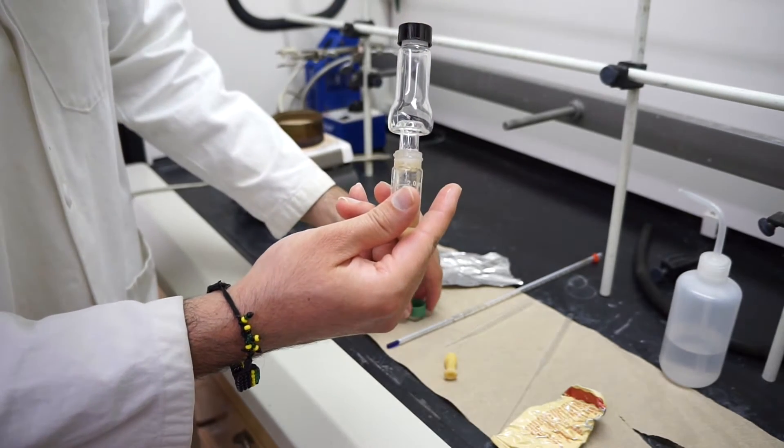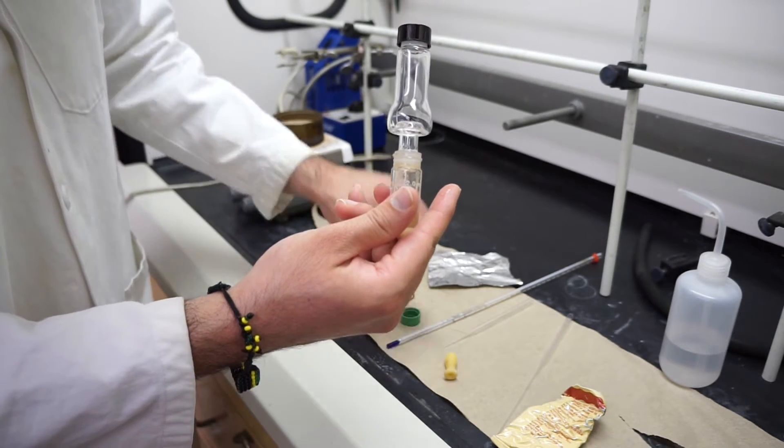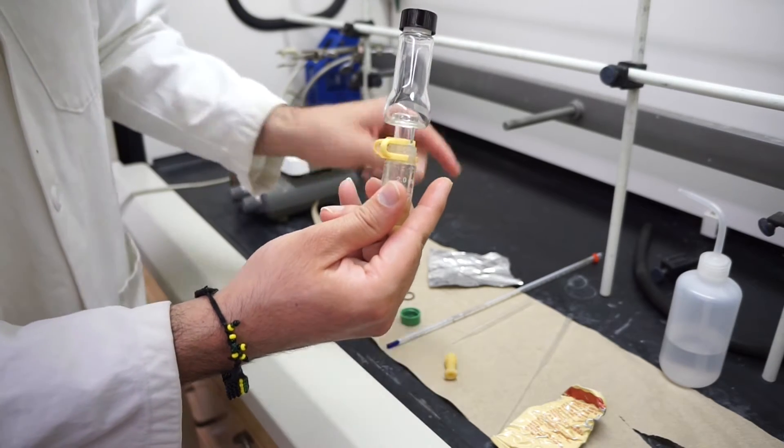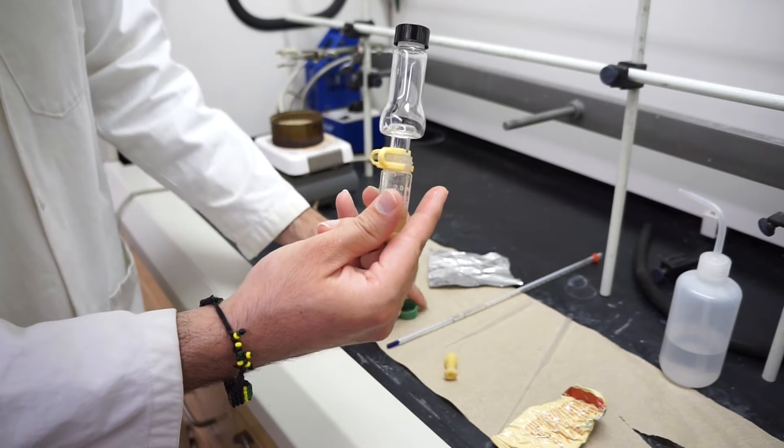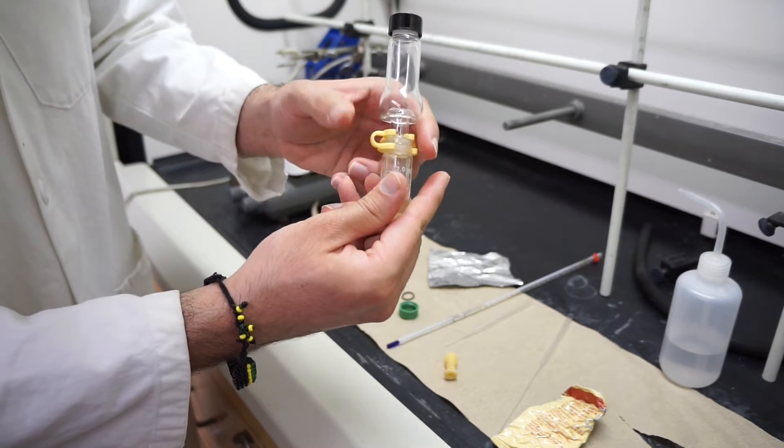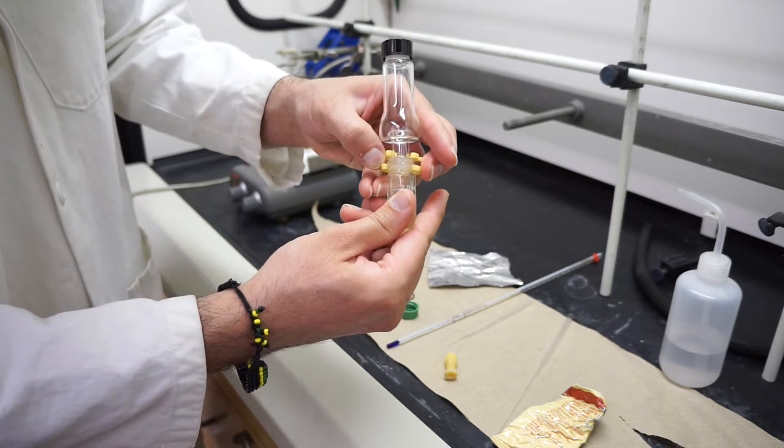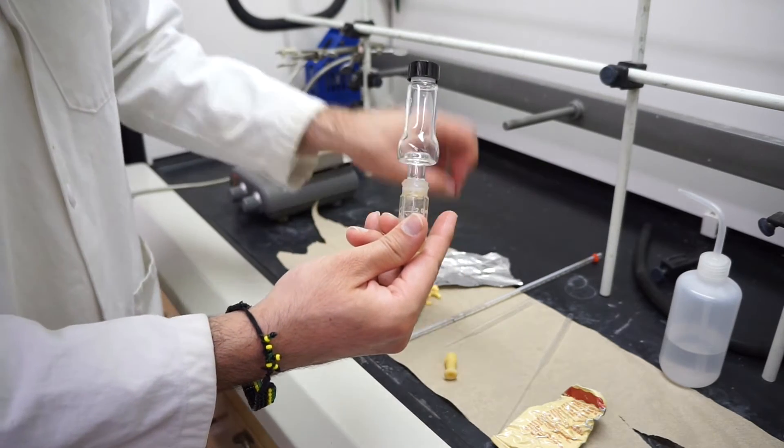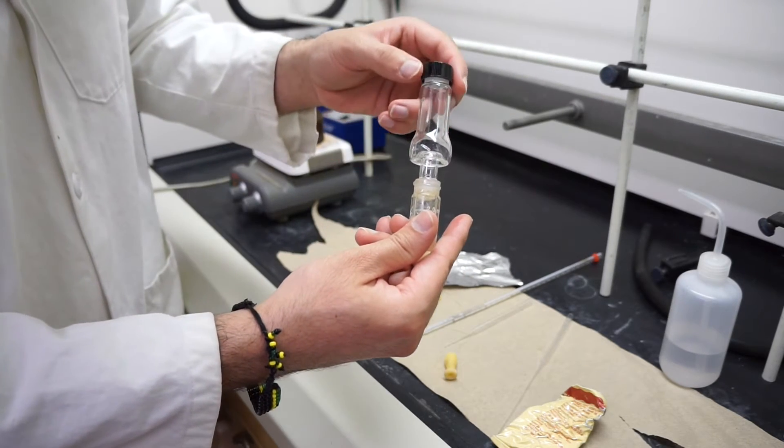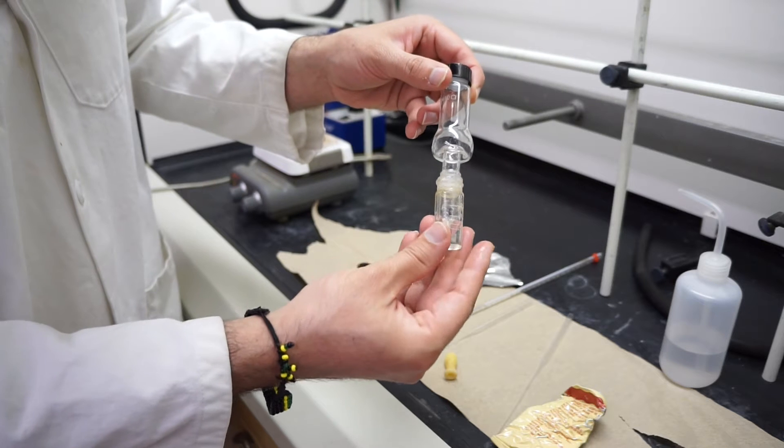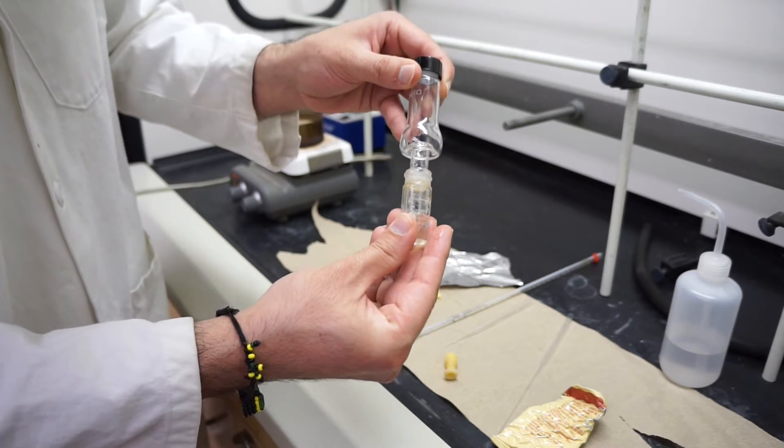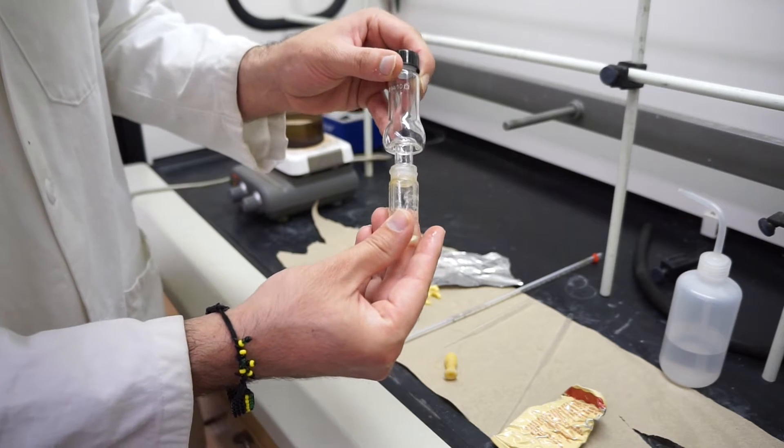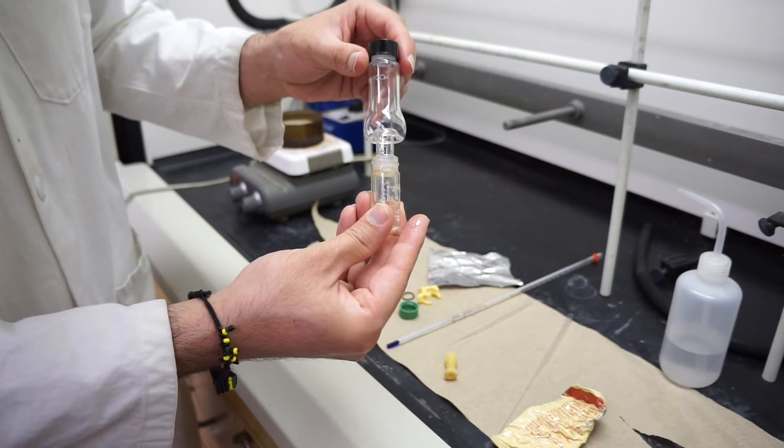You can connect these two and clamp them together with a keck clip or the cap with a rubber o-ring. However, since we're going fairly hot, we might want to avoid using these just because the plastic might melt. When we're going fairly hot, we're going to put these firmly together with grease and not attach them with anything that might potentially melt.